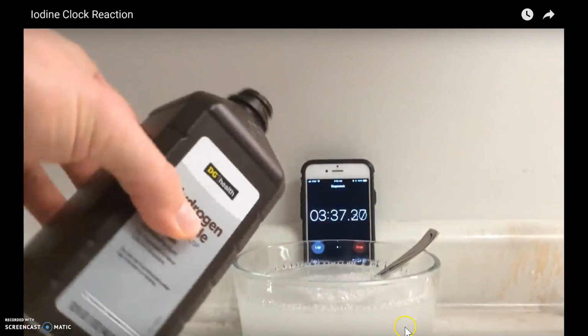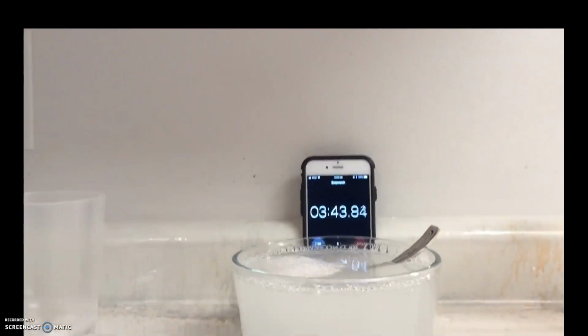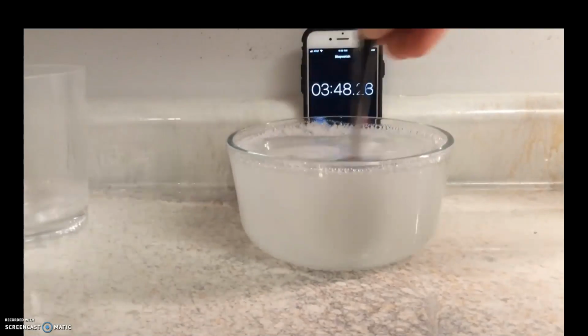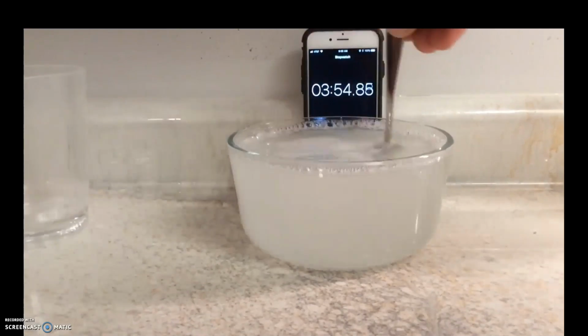So here you'll see me pouring in more hydrogen peroxide to try to get the excess. And I'm not saying that I didn't have enough to begin with. I think that without heating, the reaction was going to take longer. I mixed for approximately 5 minutes, and perhaps without heating, that reaction will actually take longer.